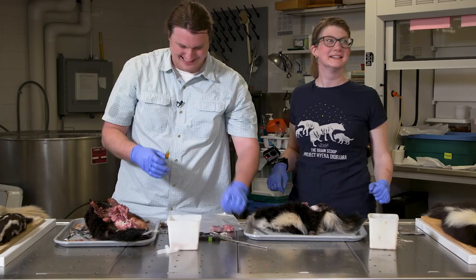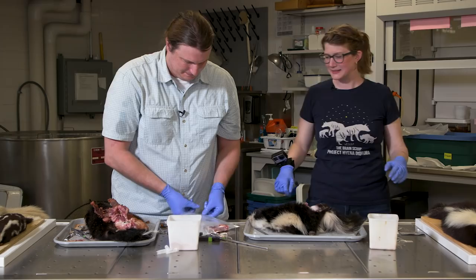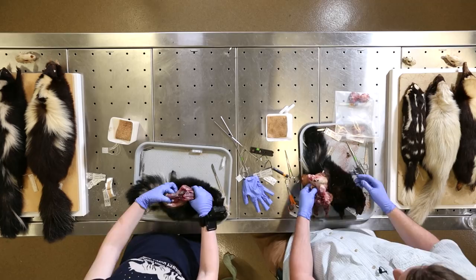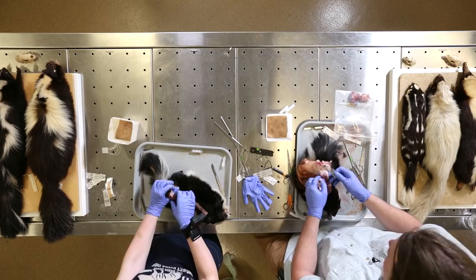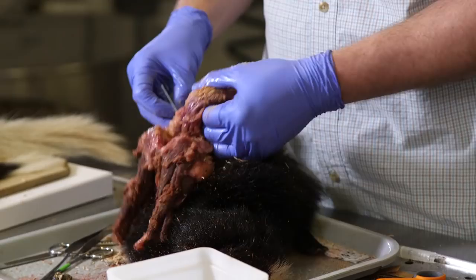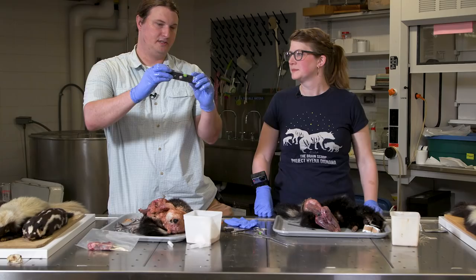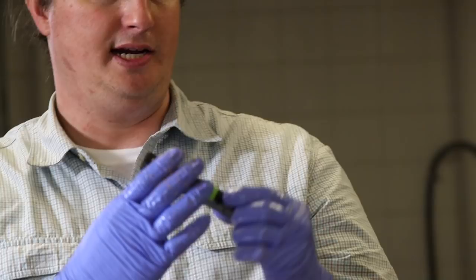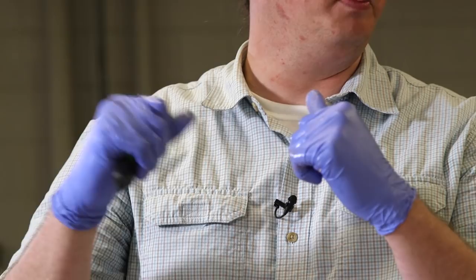Seal that up. Now just like any other mammal, we pull the tail out. You can see why we might need the tail puller — it comes in two sizes for large and small tails. What it does is give you grip without squeezing the tail so you don't break the bone off, and then you just pop it out.